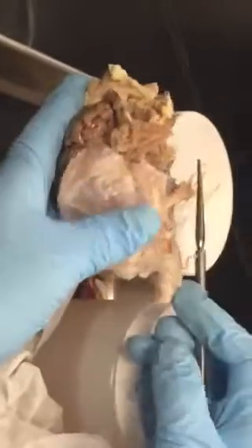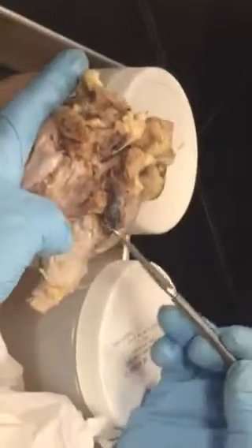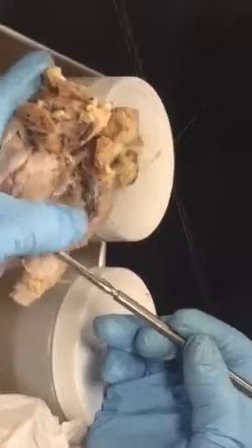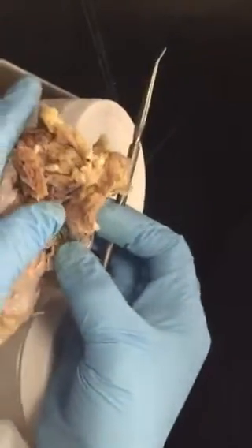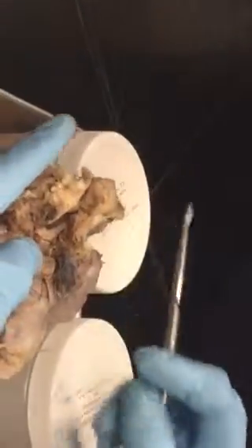Okay. Now, here, if you take a look, okay. Sorry, I was pointing to the wrong place when I said this. Did I say this is the pons? Yes, this is the pons. That's good. And the next part is medulla, right? Right. So now I want to show you the third cranial nerve.